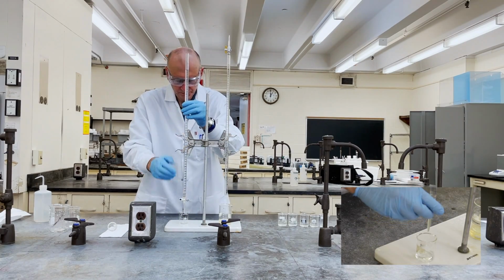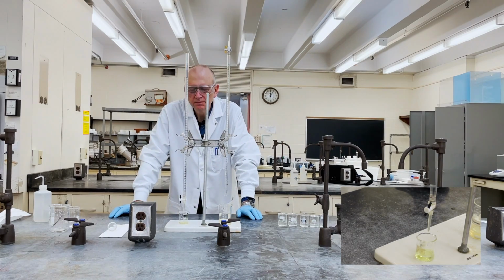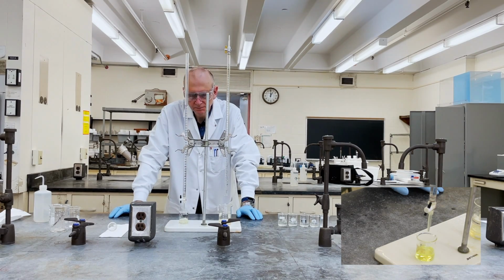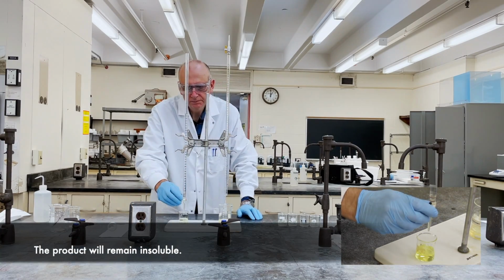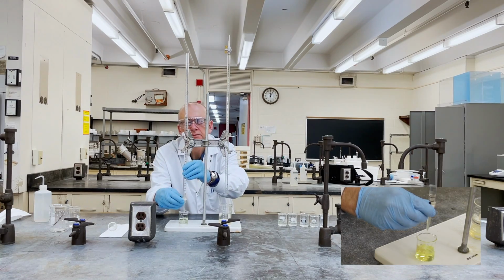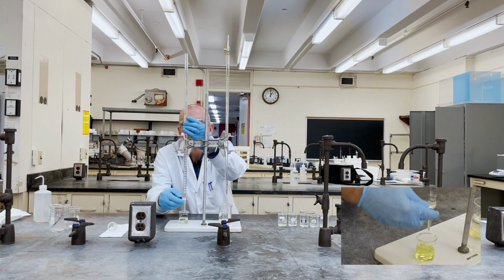Start by dispensing 22 milliliters of the oxalic acid into beaker number 1. A precipitation reaction will occur once the oxalic acid mixes with the unknown solution. Continue by adding the oxalic acid into beakers number 2 to 6.